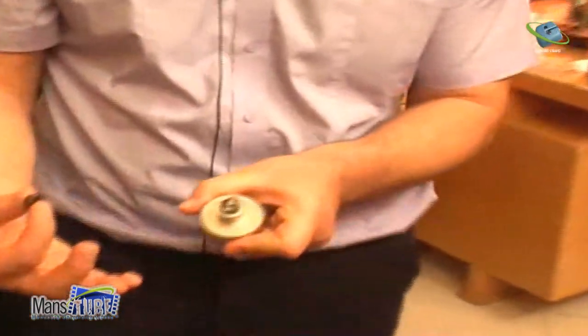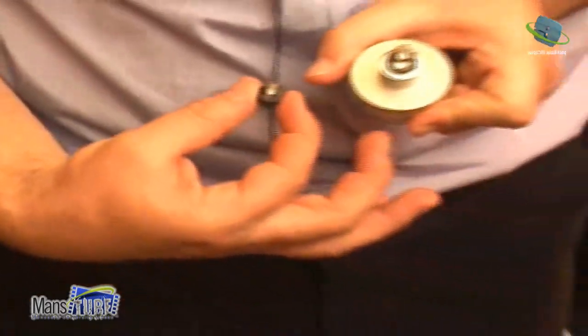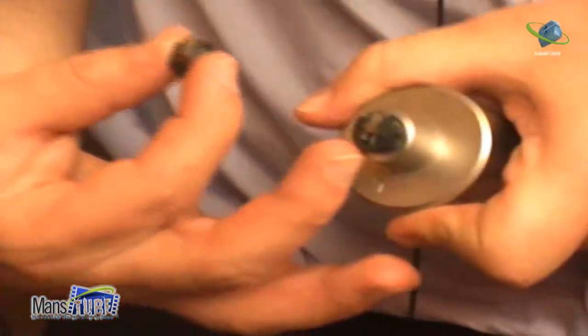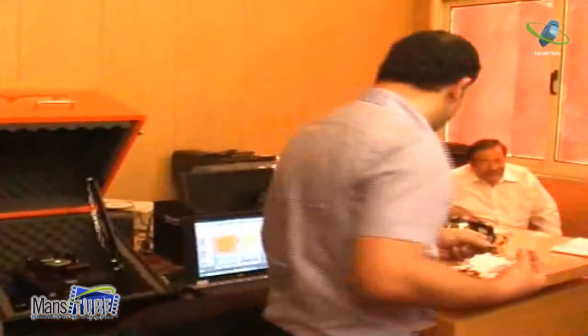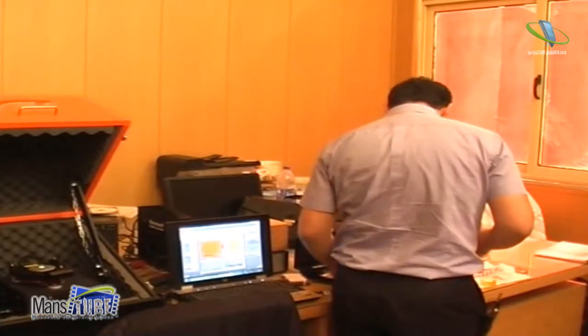Okay, so is it clear for you? You see, here there is nothing, it's empty, and this one has a transparent film. You see the films? Okay. And now what we do, we put a cantilever.